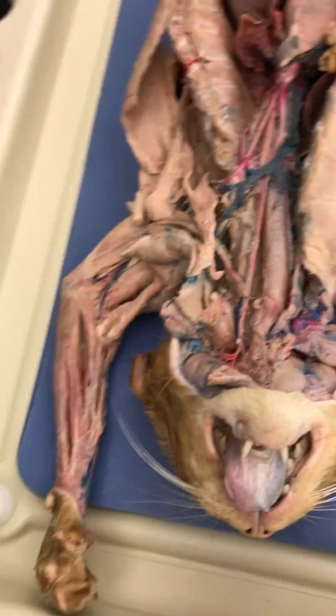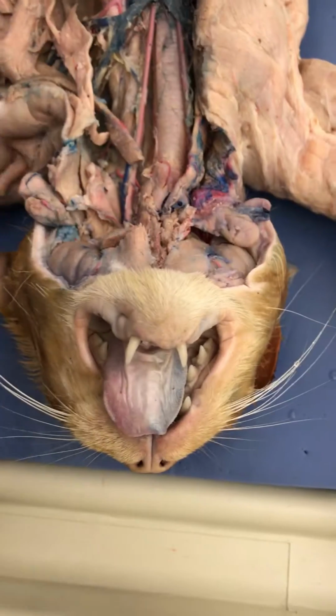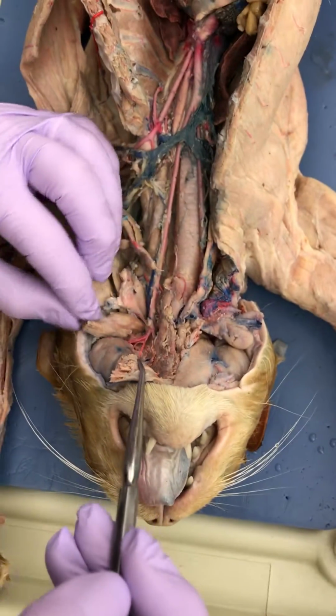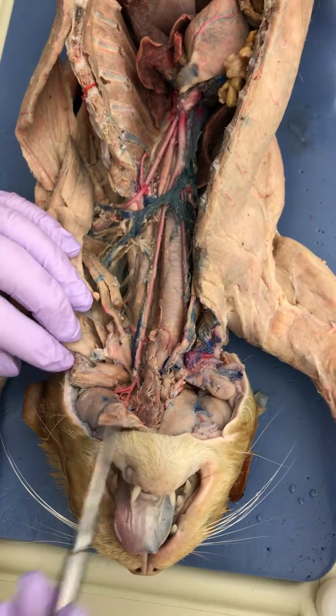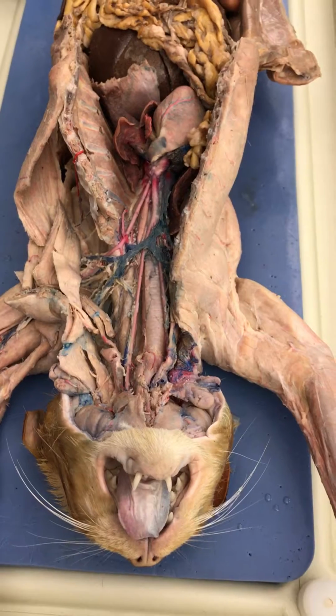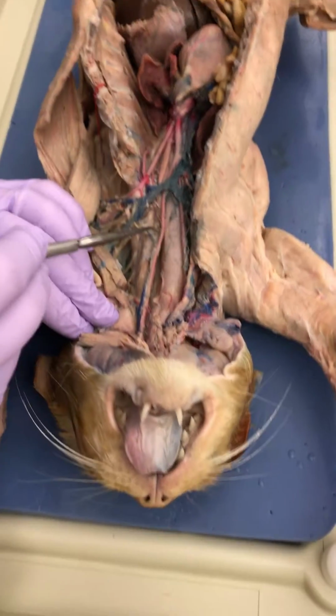Well, your digastric was hiding it. See, look, that's digastric. So when we bisected it and then reflect it, you can find stuff. So when you put digastric back down, you don't see much of anything, really. Okay, so that was up the carotid.